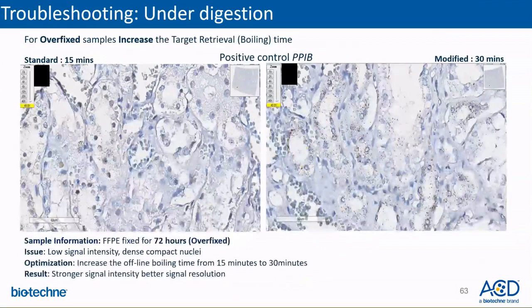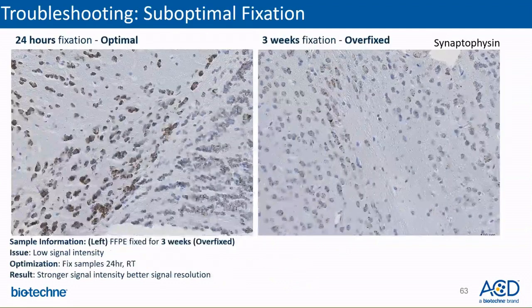Here, the target retrieval time was increased to 30 minutes, which improved signal intensity and resolution, and also eliminated trapping of the chromogen as seen in the image on the left. Shown on the right panel is an image of RNAscope performed on a sample that was fixed for too long. As you can see, the signal is very weak. To avoid such issues, we highly recommend following the sample fixation steps provided in our user manual.